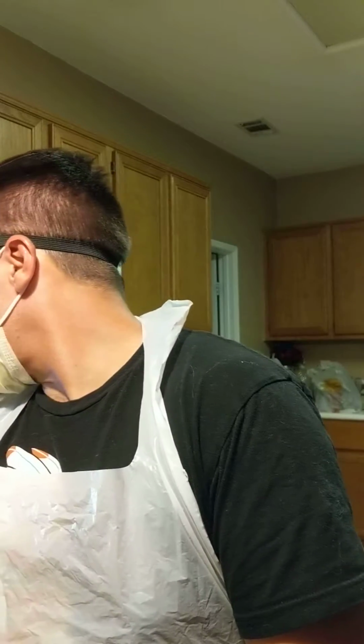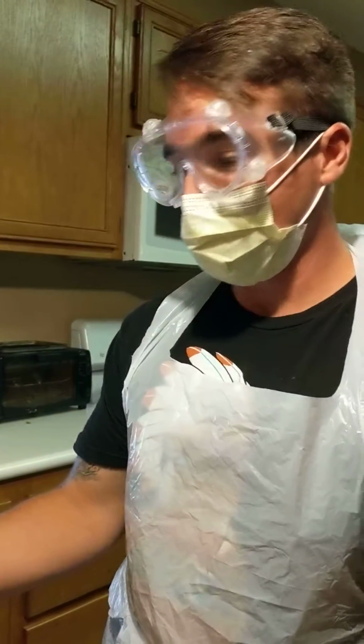This is my lab assignment on the Kirby-Bauer test. This is going to be the antibiotic sensitivity diffusion test, also known as the Kirby-Bauer diffusion test. So as you can see here, we have my setup.